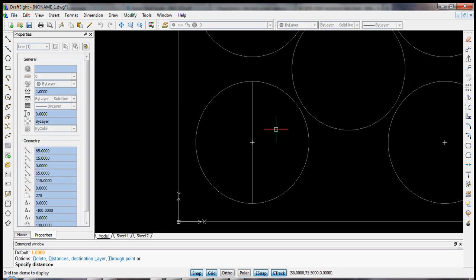Now that's for distance. How far do we want to offset? In this case, what we want to do is divide up this 4-inch wafer, this 100 millimeter circle, into 20 millimeter squares. So we'll type 20, enter, and it asks for which side should the destination. We'll hit B for both sides, and you can see it's copied that exactly 20 millimeters apart.